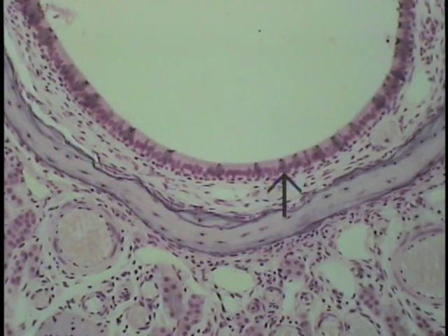We'll examine this in detail in just a moment. The lamina propria, the connective tissue thereof, anchoring this mucous membrane, forming a mucoperiosteum directly to bone. This thin scroll-like bone, the conch bone, is shown at the pointer. Typical bone.